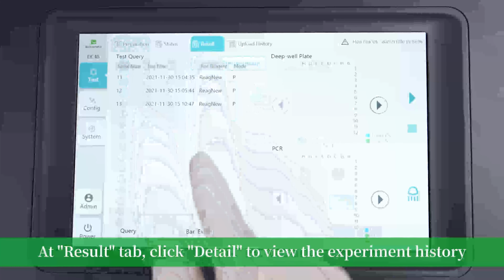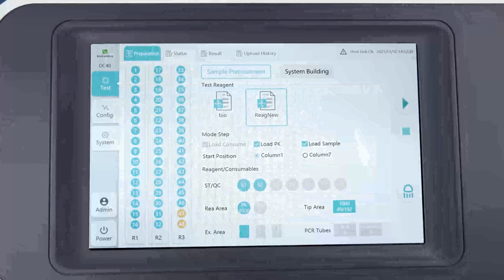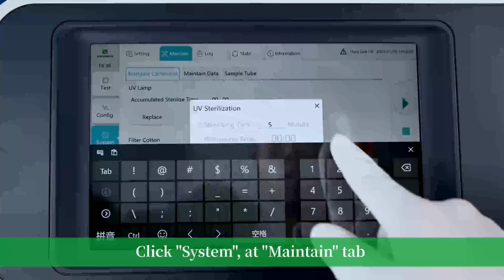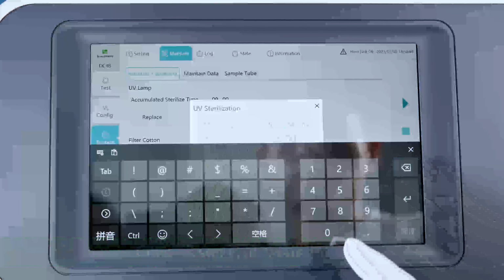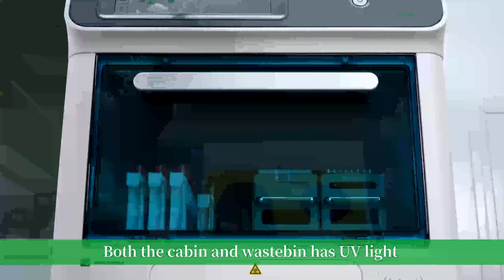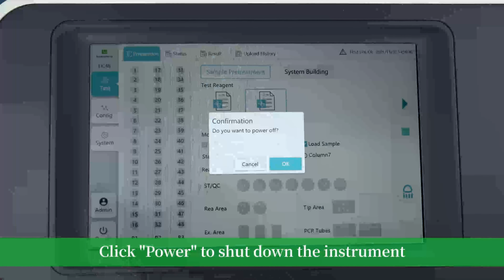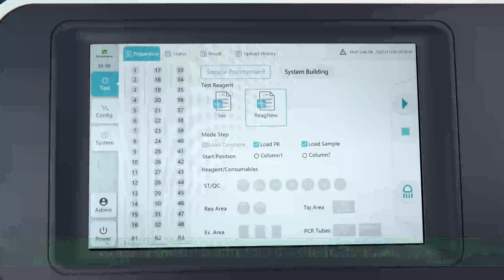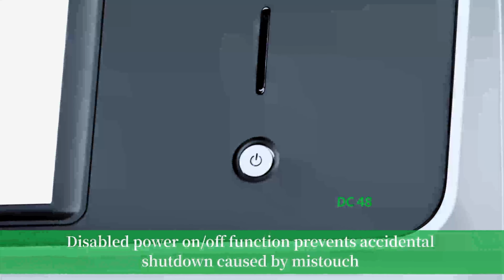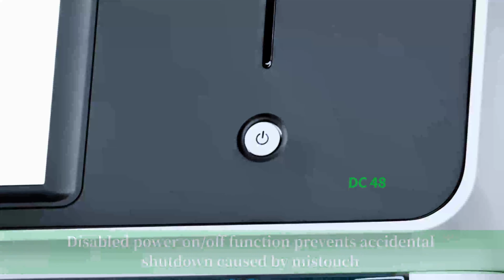At the Result tab, click Detail to view the experiment history. Click System at Maintain tab. Set UV light for sterilization. Both the cabin and waste bin has UV light. Click Power to shut down the instrument. The standby button will be automatically locked. Disabled power on and off function prevents accidental shutdown caused by mistouch.